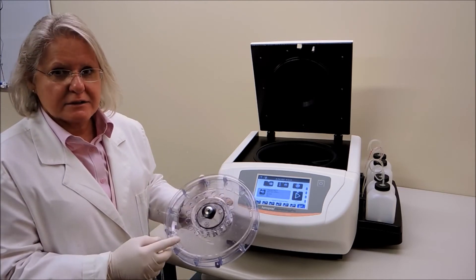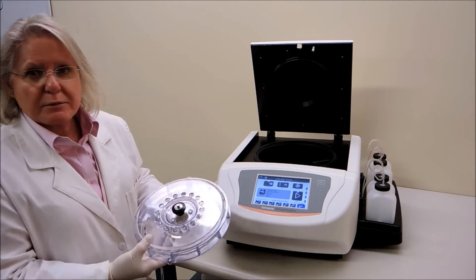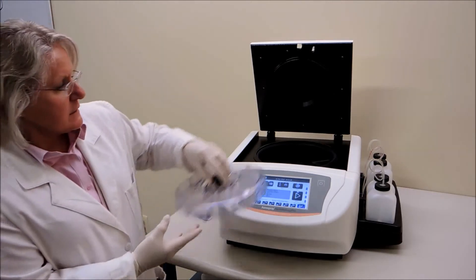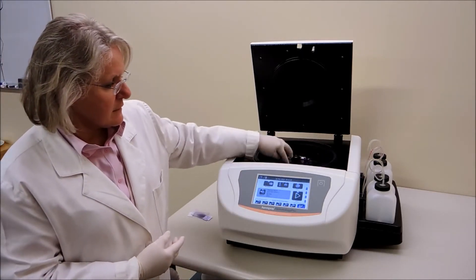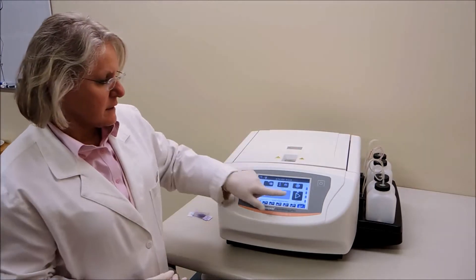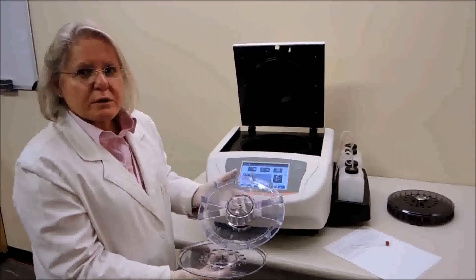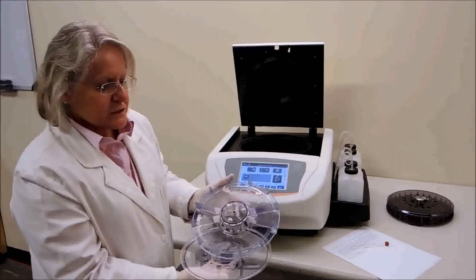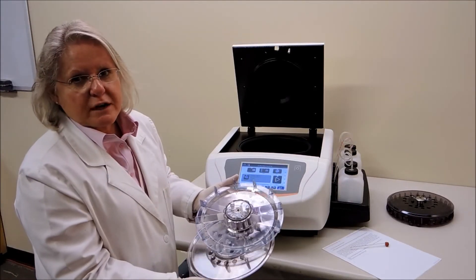Now the instrument is programmed to rapid number nine — fixation at zero, 50/50, spin is one, and rinse is five. Now we need to add the carousel, add an empty carousel, and push run. Close the lid and press run.